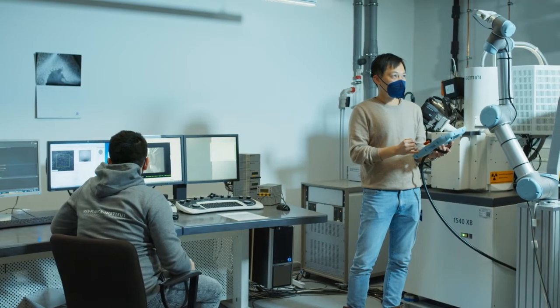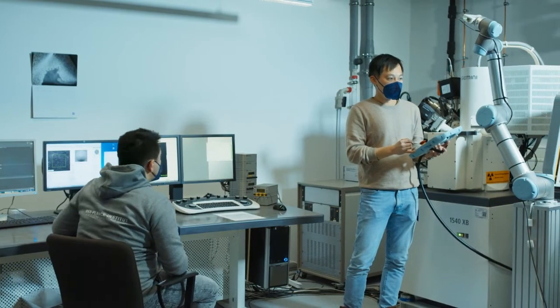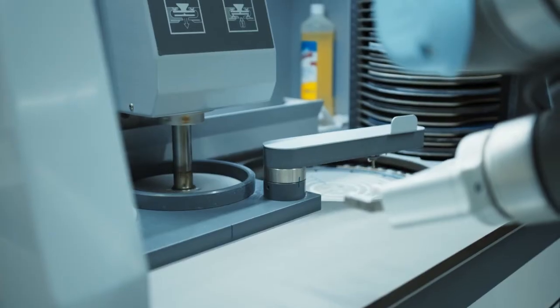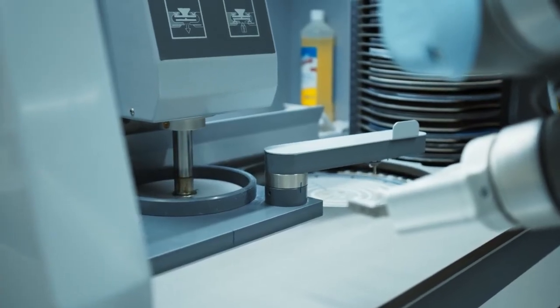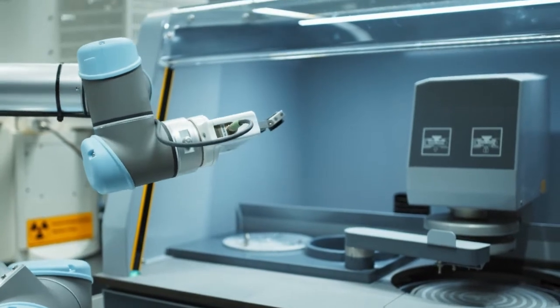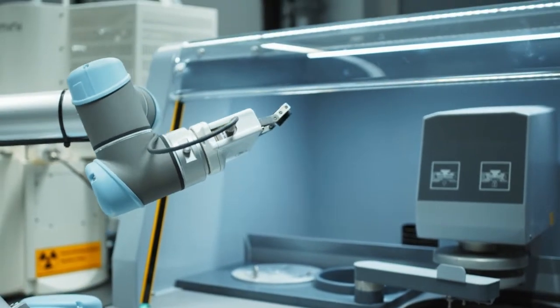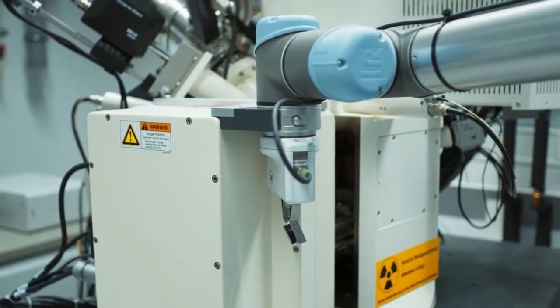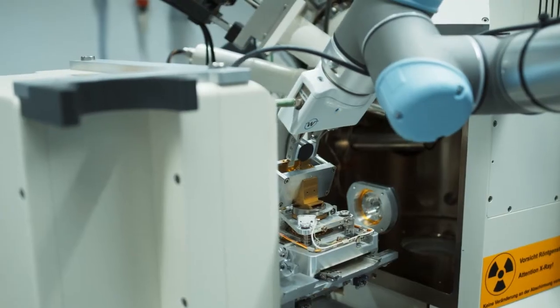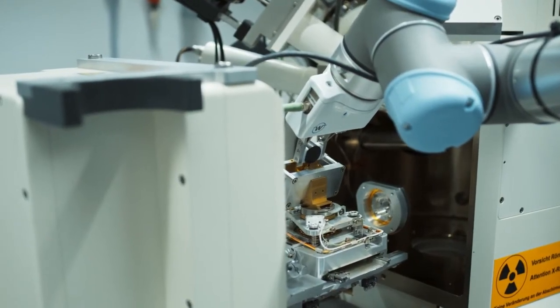Here at MPIE, we have developed a setup to address these two challenges. It is called the robot microscope. In the robot microscope, the samples are polished and prepared automatically. Then a robotic arm takes a sample, moves it to the microscope, and the microscope automatically collects the data from the surface of the sample.